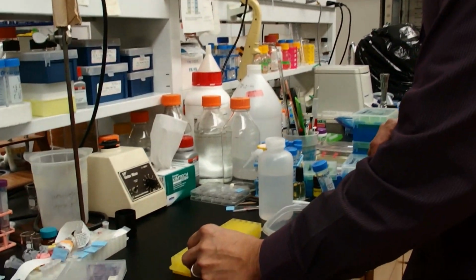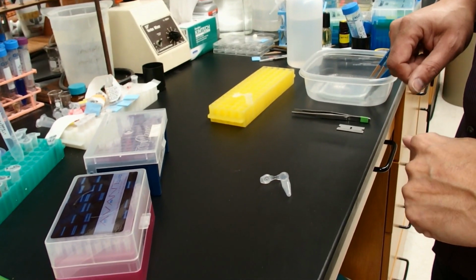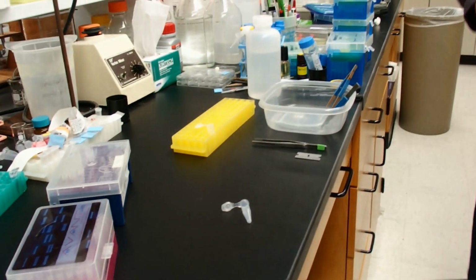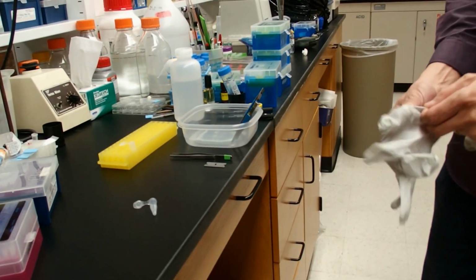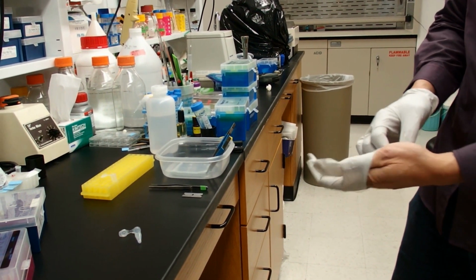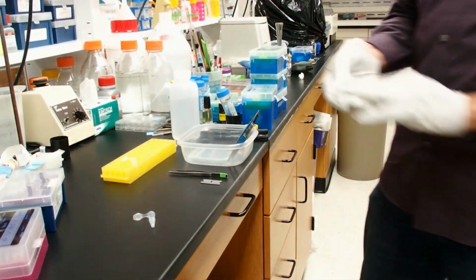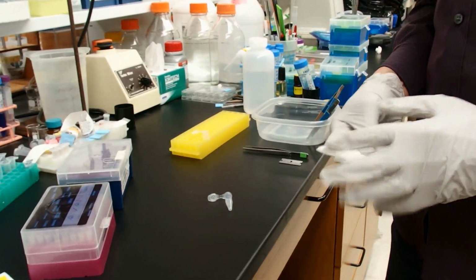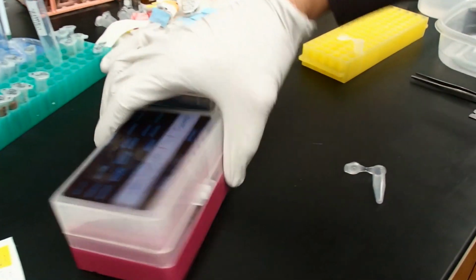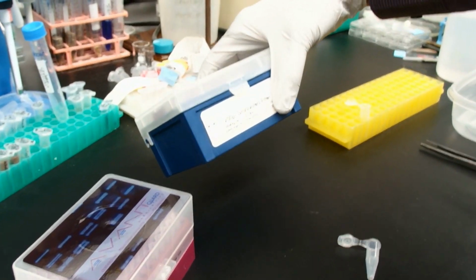So, in order to make this, you could buy the filter cups already from Bio-Rad, or you can make them for next to nothing with a filter pipette tip and a standard Eppendorf tube. I'm going to make two different sizes here. We have our filter tip 10 microliter pipette tips, and we have our filter tip 200 microliter pipette tips.